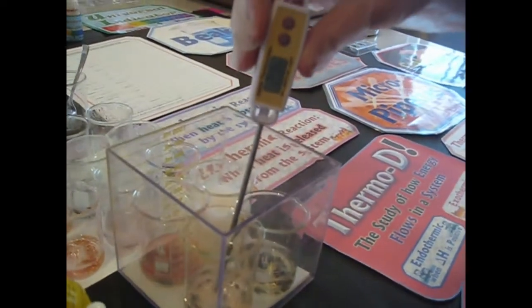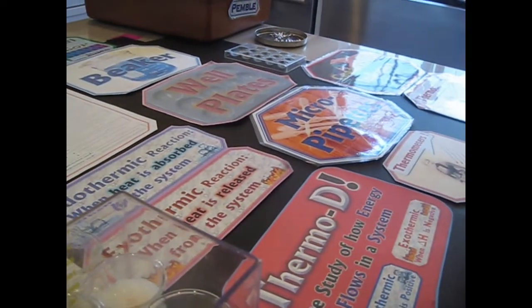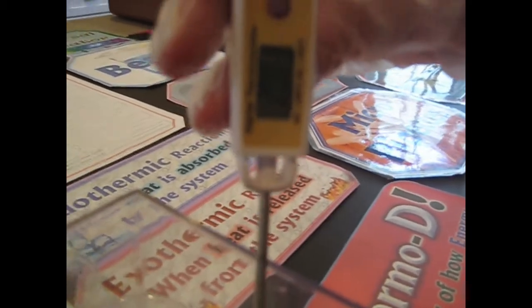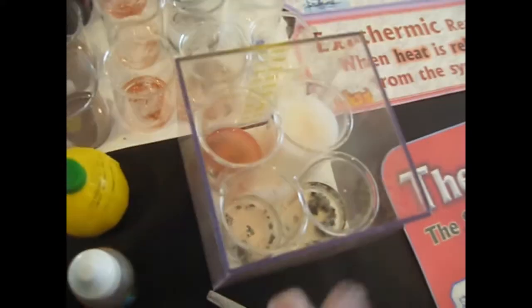We should have taken the temperature before and after. 21. And the Pellegrino was definitely cold. So let's just get the other one. 21. 21, and what's the other one? Let's see which one is warmer of the two. This is 20.8. So which one was warmer of these two? This one. Oh, you know what we can do?